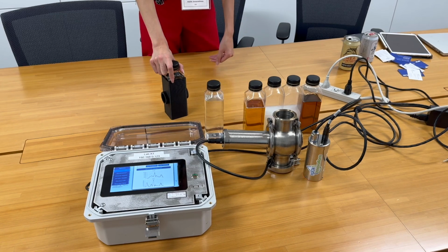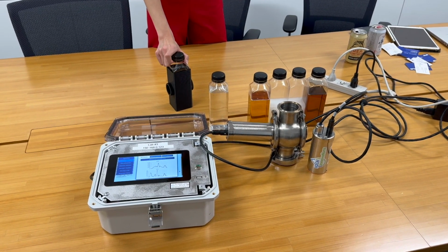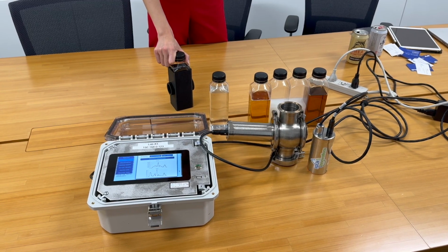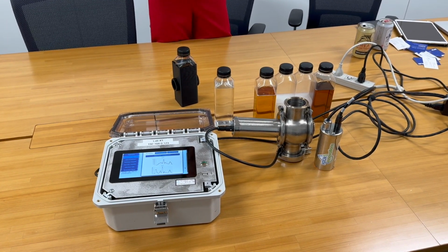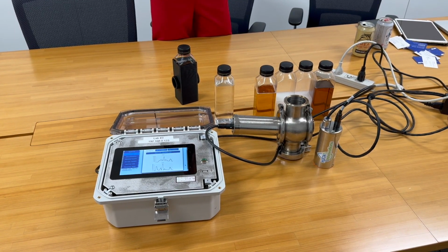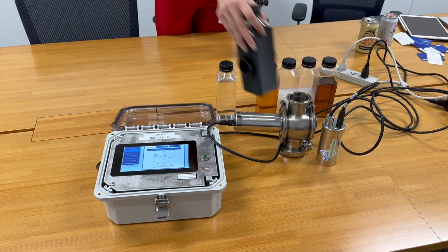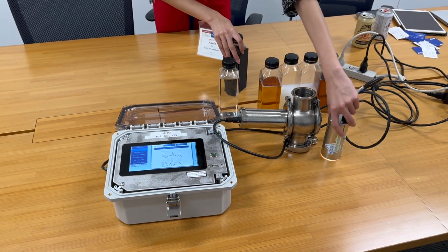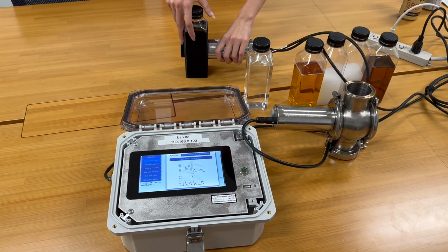So you want to know, when do I fully push out my previous product in my changeover? When do I hit 100% water? Instant feedback, start pushing the next product. When do we reach 100% good quality in my next batch? When can I send this to the filler instead of sending this to waste, to reduce product loss and improve line efficiency? And so I'm going to just put this in this testing unit here.